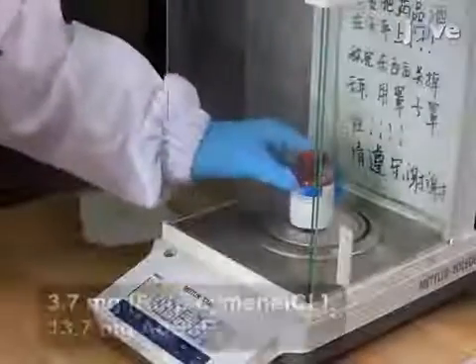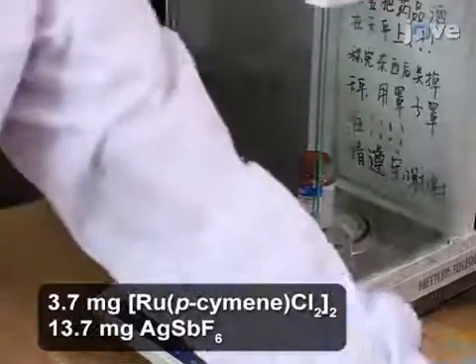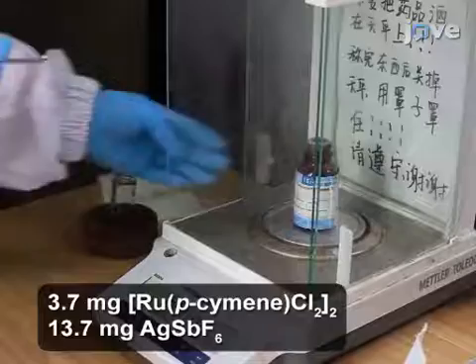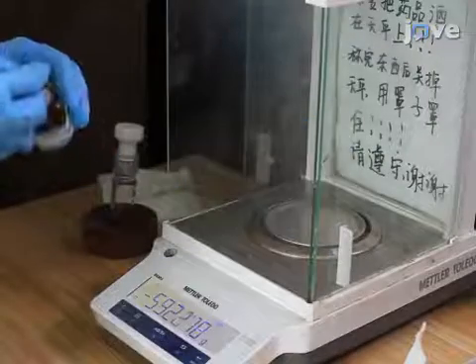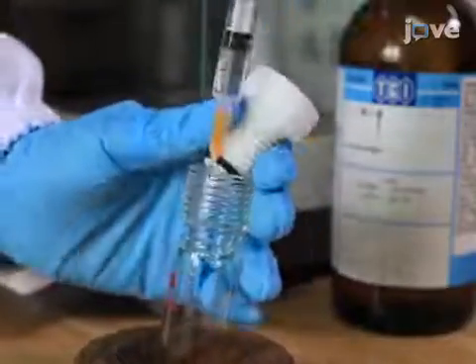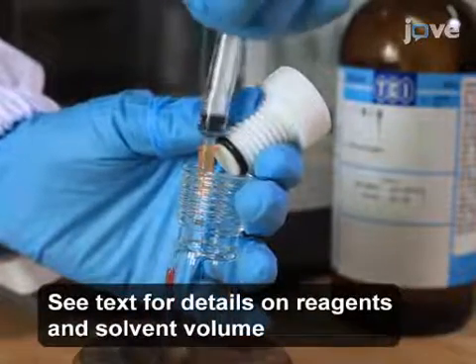Using an analytical balance, weigh 3.7 milligrams of ruthenium-cymene chloride dimer and 13.7 milligrams of silver hexafluoroantimonate into the reaction vial. Next, add 1 milliliter of dry 1,2-dichloroethane to the reaction vial.